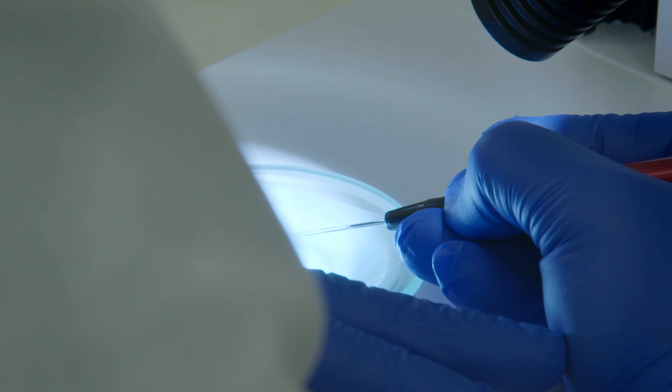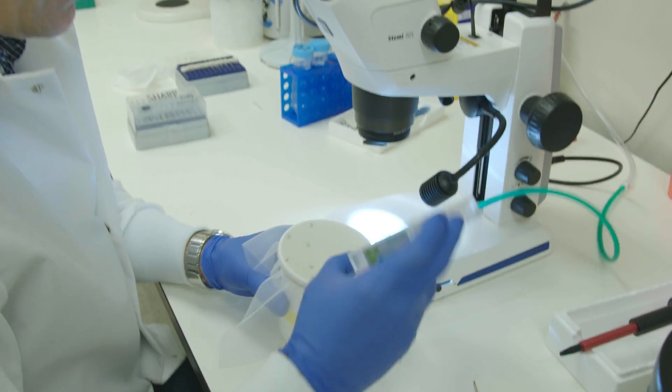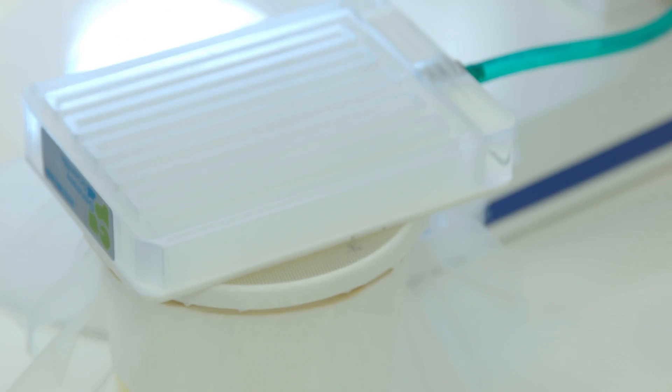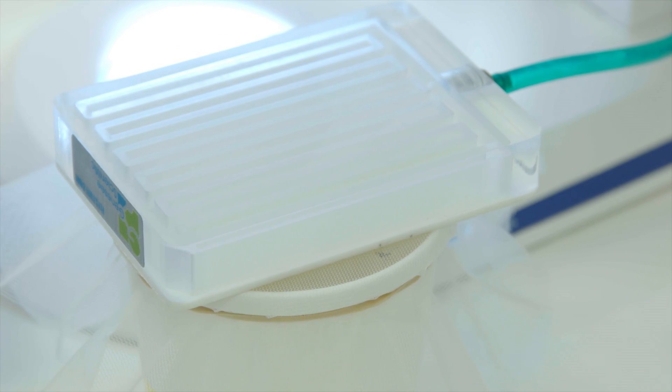Now that we have our needle filled with the double-stranded RNA, it's time to anesthetize the mosquitoes. We work with CO2. I have a pad, I put it over the cup of mosquitoes to make them fall asleep.